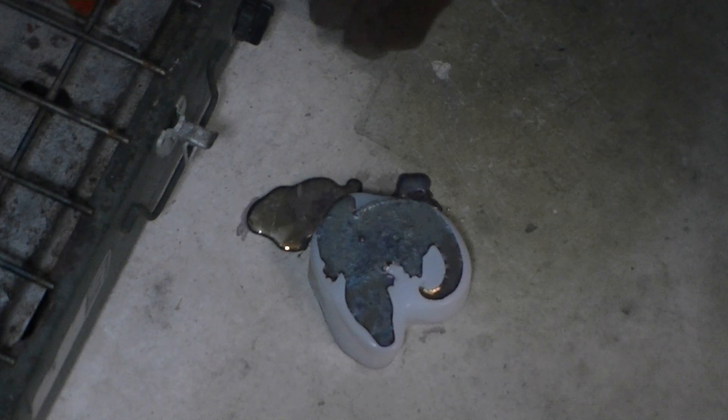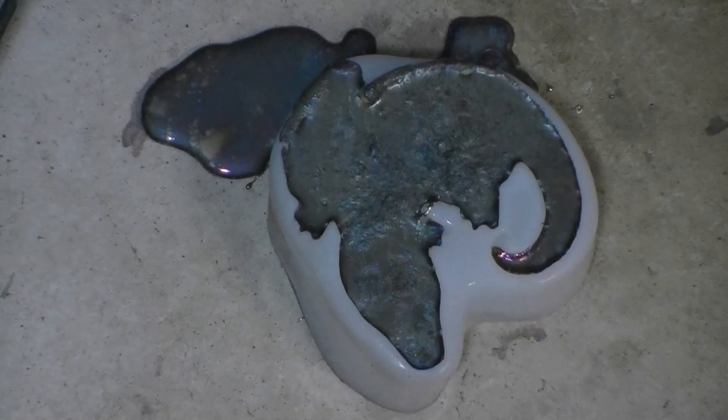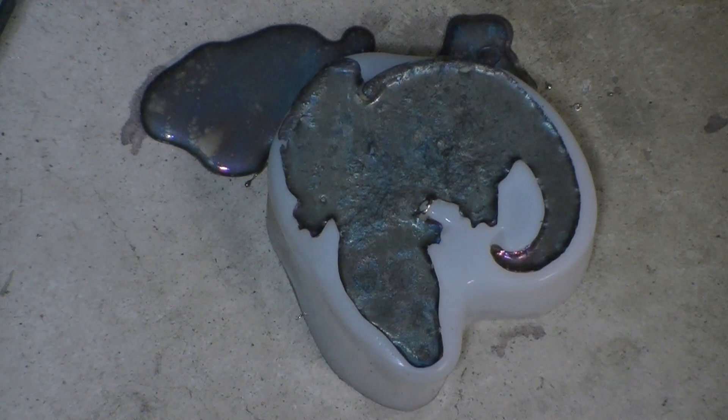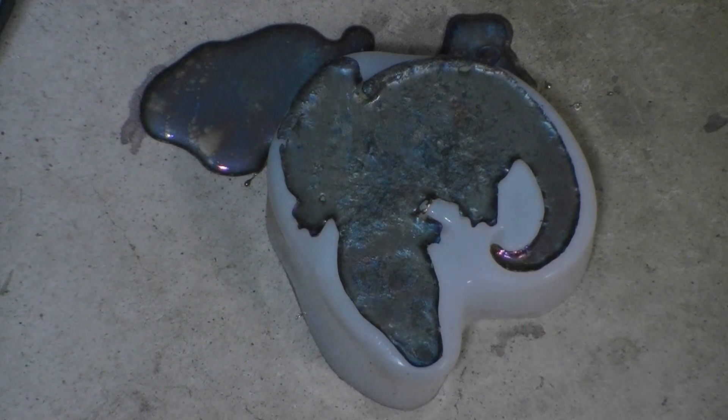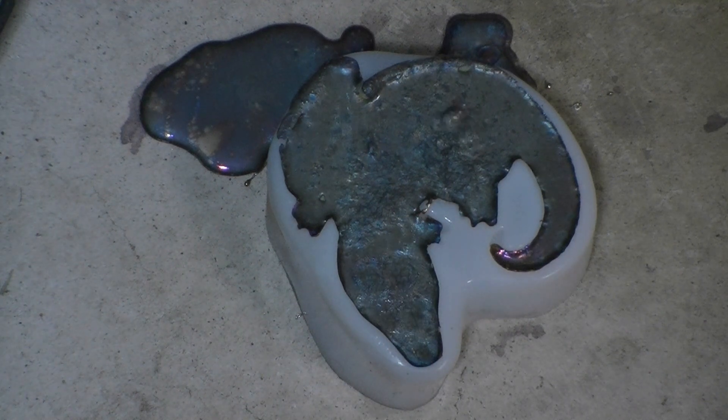When we pour our bismuth metal into this mold, we can see some bubbling occurring. This is definitely not bismuth metal boiling, as the boiling point is 1,564 degrees Celsius. This is more likely moisture or a mold release agent present within the mold.